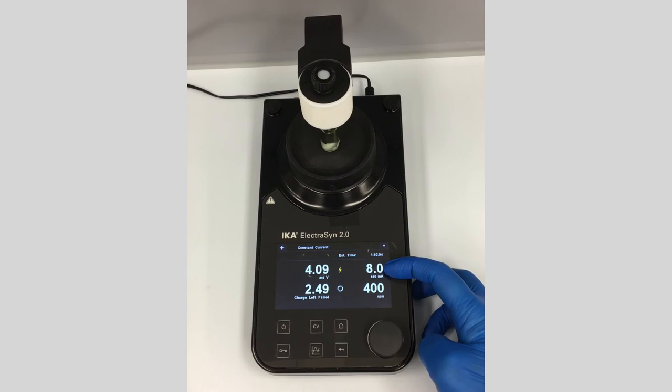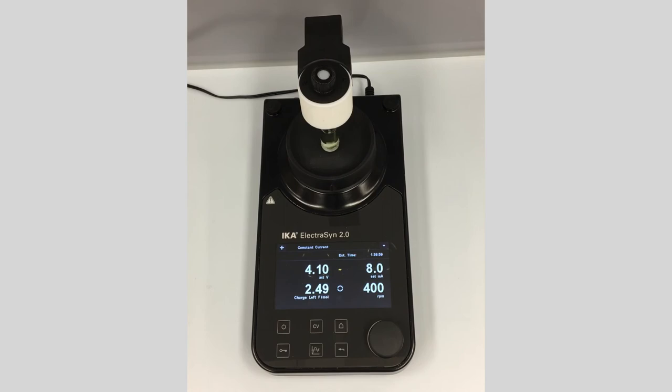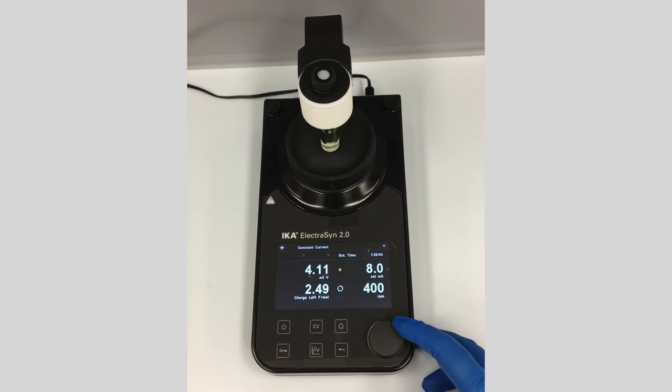The set milliamps is shown as 8.0 milliamps. Charge left is displayed — we started at 2.5 Faradays per mole and that counts down until the reaction is complete. You can also adjust the stirring rate with the dial.